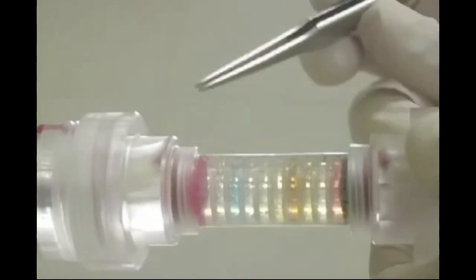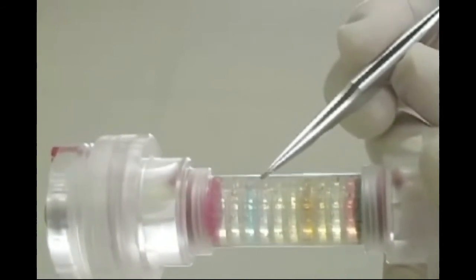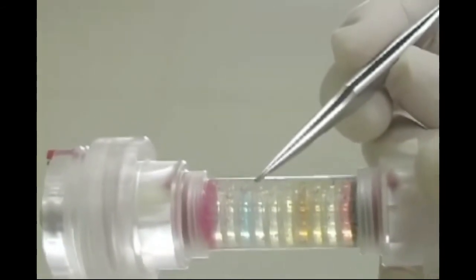Phycocyanin is a blue protein with subunits ranging in PI from 4.5 to 5.5. This protein is expected to focus towards the anode in fraction number 3.